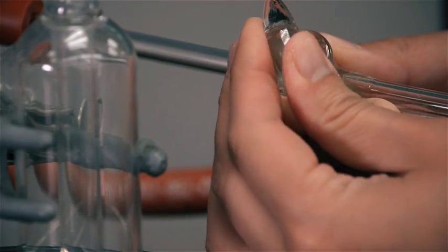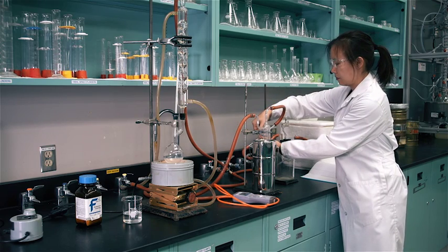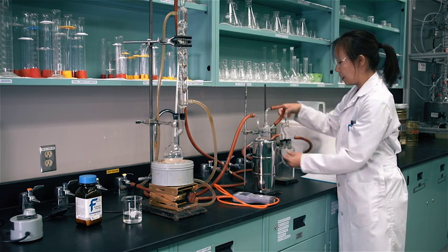The path to the vacuum pump is closed when this stopcock is closed. The stopcock is used to control the vacuum during the experiment.